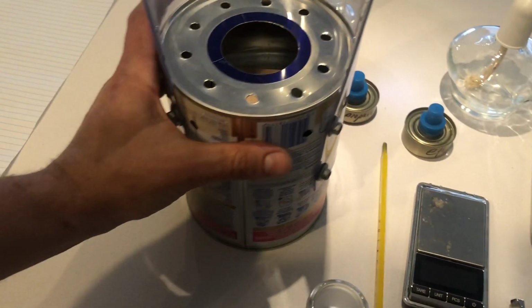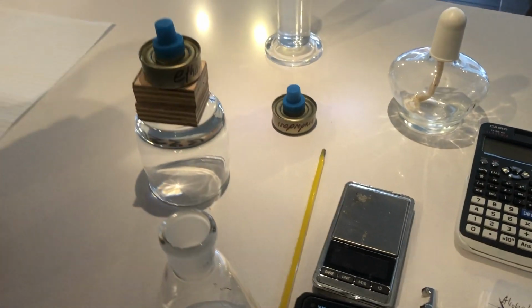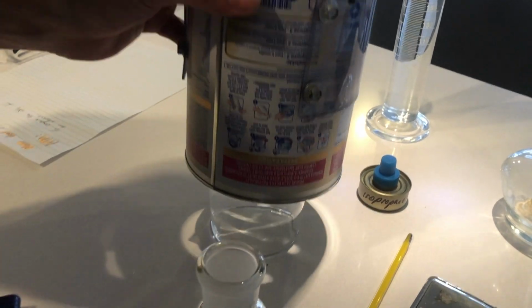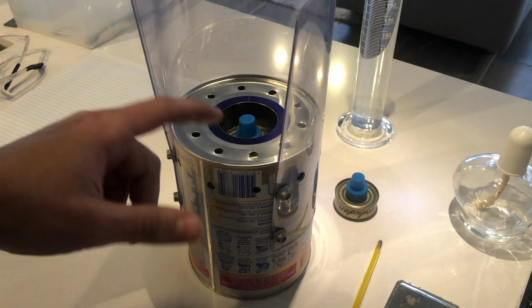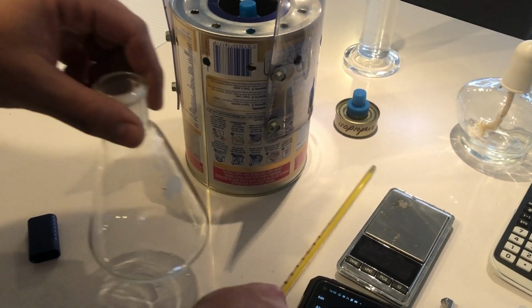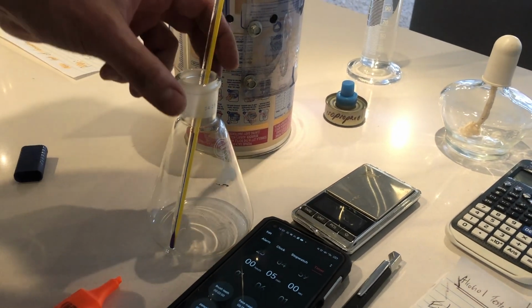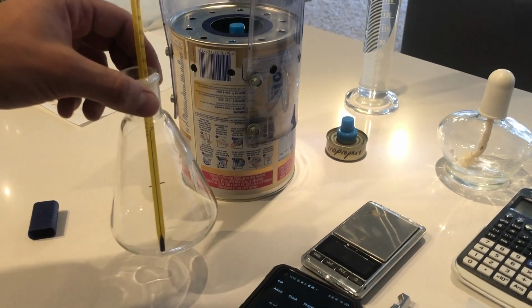Looks like this. So it acts like a heat shield. So we're doing ethanol first. It'll go there. We'll take the lid off after we've done our measurements of the weight, and we'll pop on our, it's like a tripod. This one's got some holes to let the oxygen in so the burner stays alight. We'll have a container full of water. We'll take the initial reading for the temperature of that water, wait until the temperature is stable, record it as TI. We need to make sure we knew the mass of the burner before we lit it.